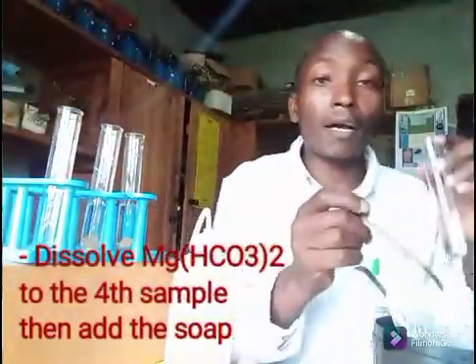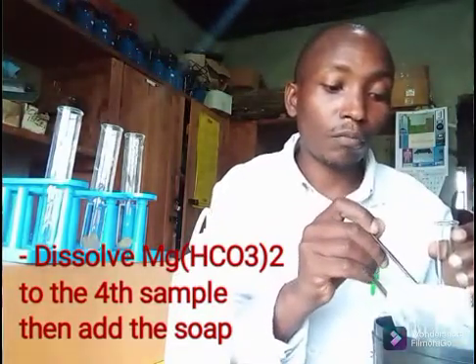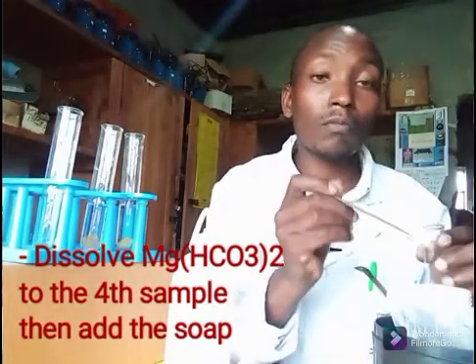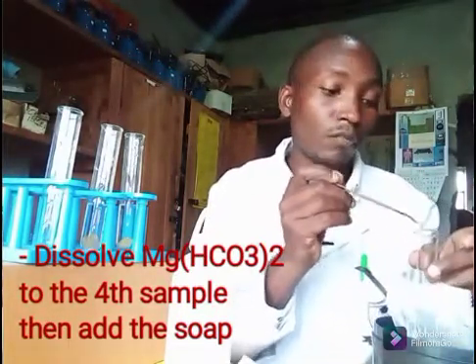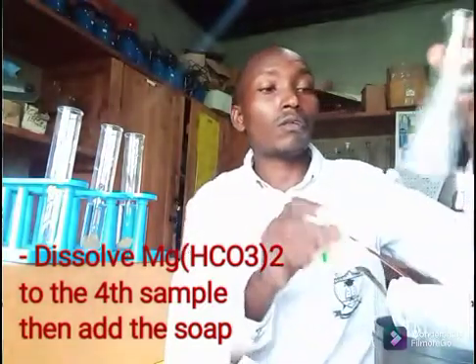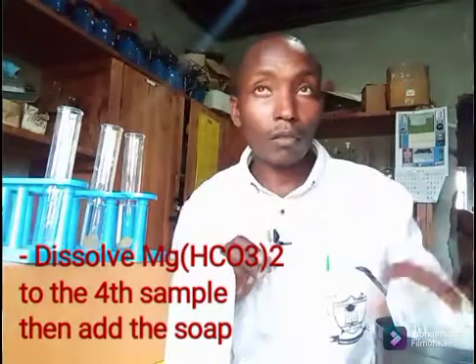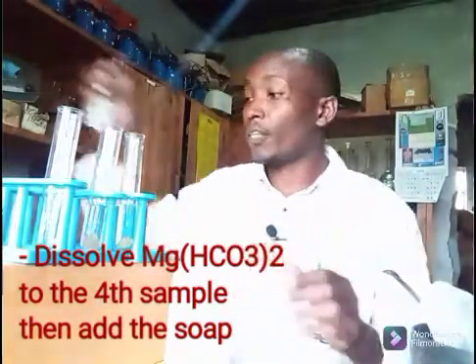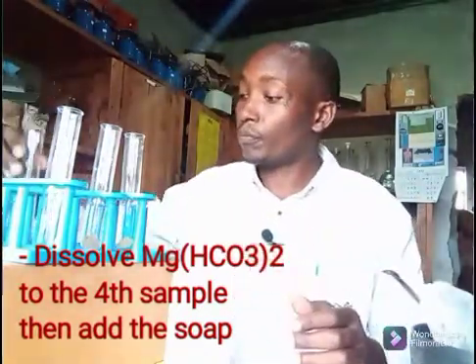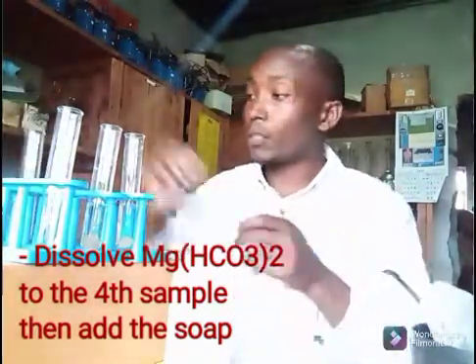The very last one, I will add a little sample of magnesium hydrogen carbonate. Then of course I put the soap sample in as well.